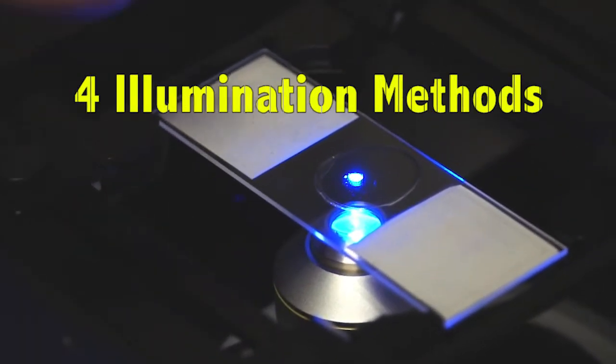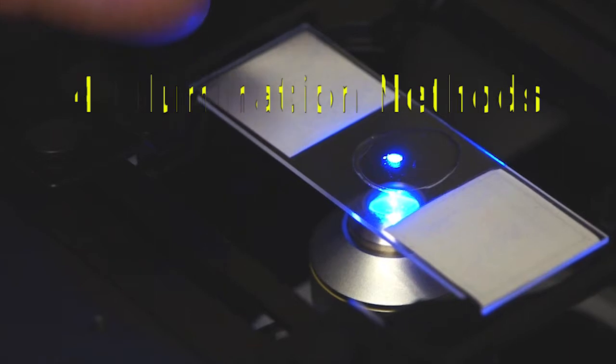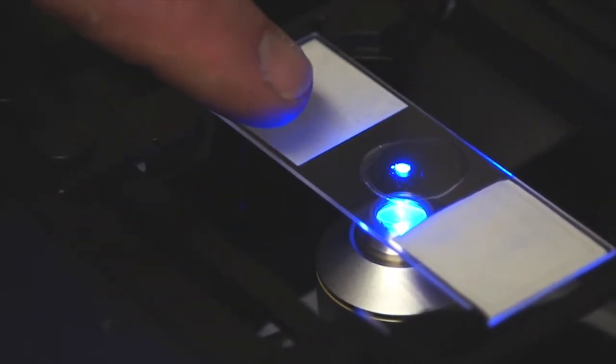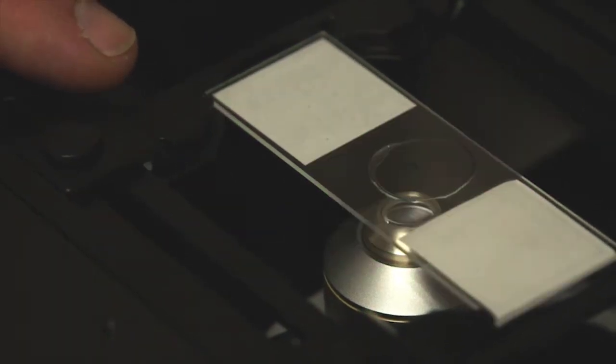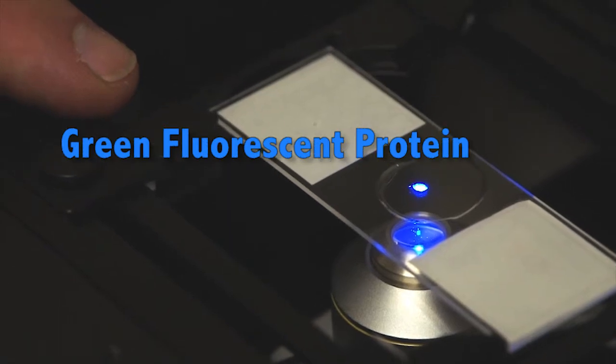We have 4 illumination methods for fluorescence microscopy on the Leica confocal microscope. The first one, as you see here, is for FITC. We also have filter packs for rhodamine, for DAPI, and for green fluorescent protein.